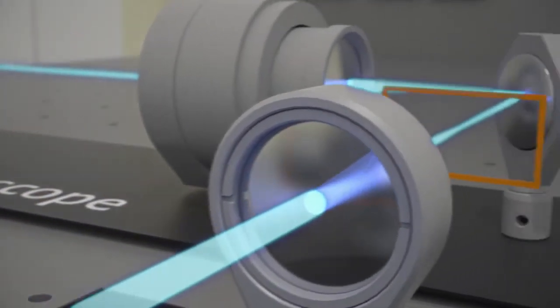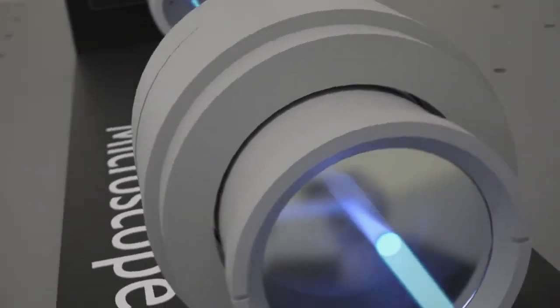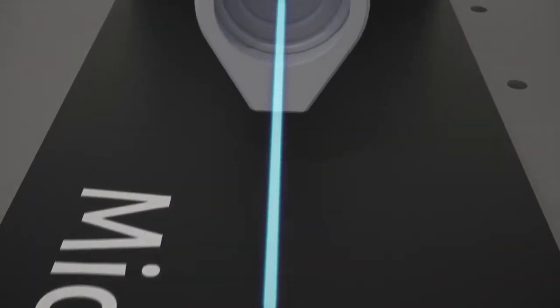The light propagates through the microscope and excites the sample in a small spot. Because of the scanning motion of the light, the scanner reads the object. The sample is labeled with fluorescent molecules. Light hitting the sample excites these molecules, and immediately fluorescent light of a longer wavelength is emitted. This is where the emission light path starts.